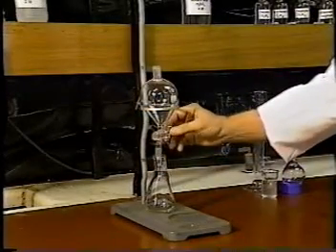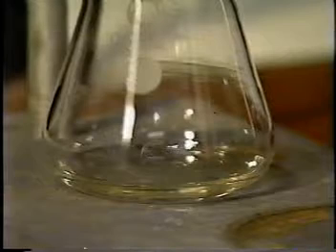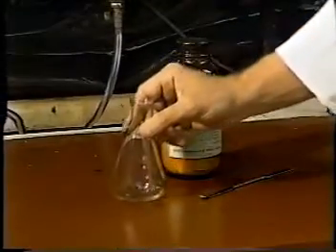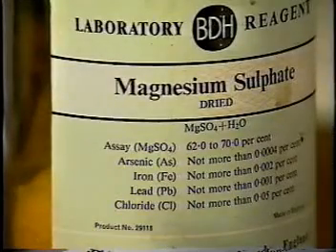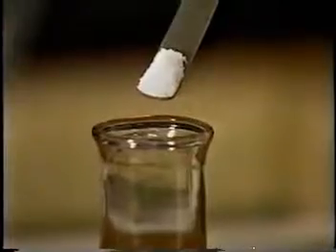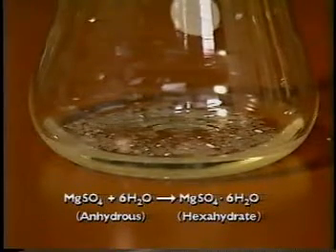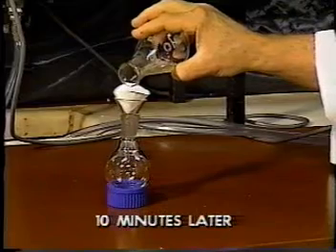Because our ester has been shaken with aqueous solutions, it has some water dissolved in it, so we need to get rid of this water before our final distillation. We remove the water by adding dried magnesium sulfate. We let this stand for about 10 minutes so that the magnesium sulfate will absorb any water. Once this is done, we filter off the magnesium sulfate and collect the ester.